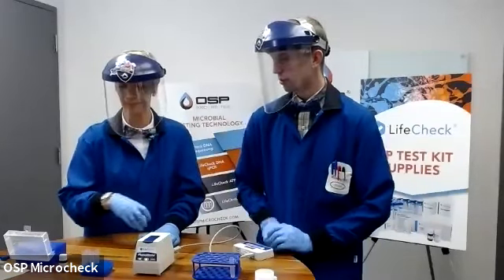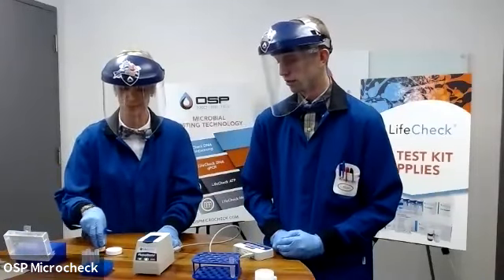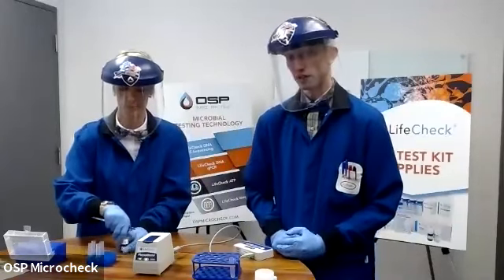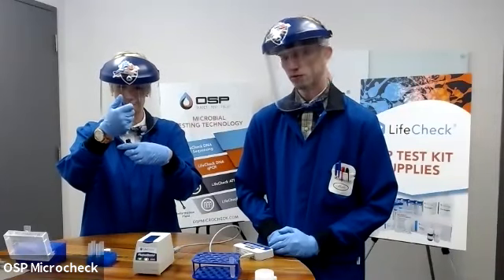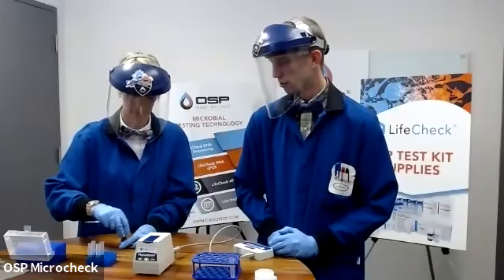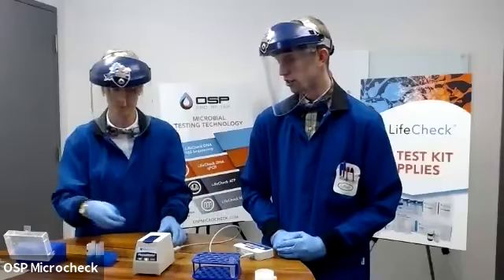So at this point, Virginia can add 100 microliters of the reagent Z to a fresh assay tube, making sure that she uses a new pipette tip, doesn't cross-contaminate any one sample from another. And after she's pipetted 100 microliters of enzyme, she will pipette 100 microliters of the sample that she just added the reagent D to.